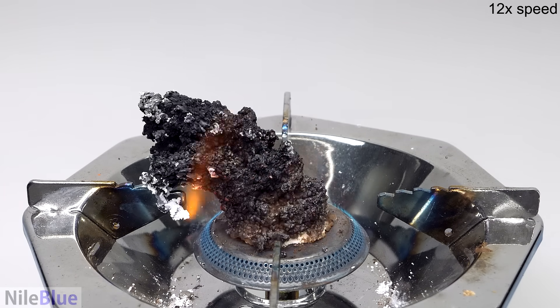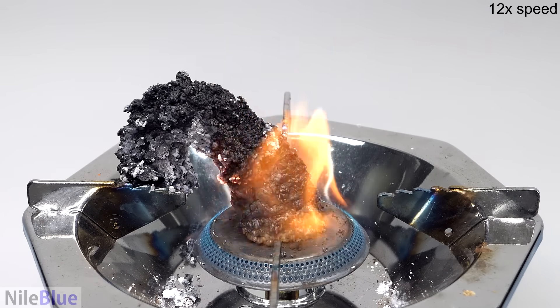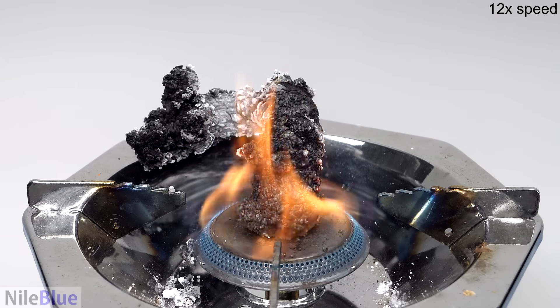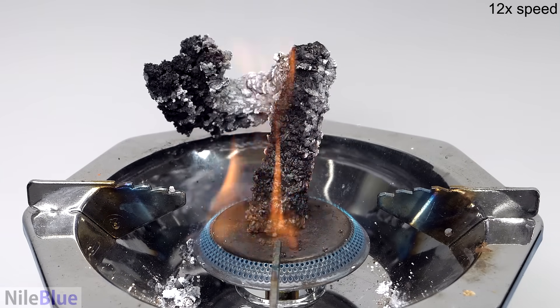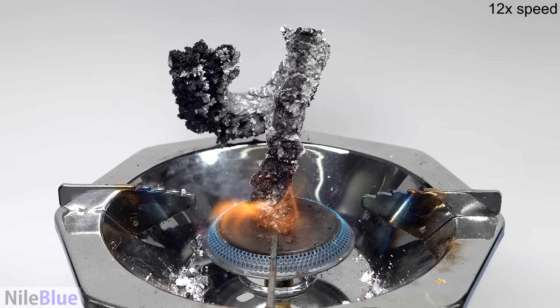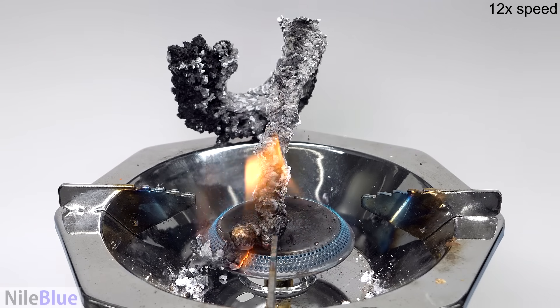Oh my god. It's turned out much better than I thought it was going to. Yeah, it's way better than I thought it was gonna be. I mean, it kind of became surprisingly snake-like.